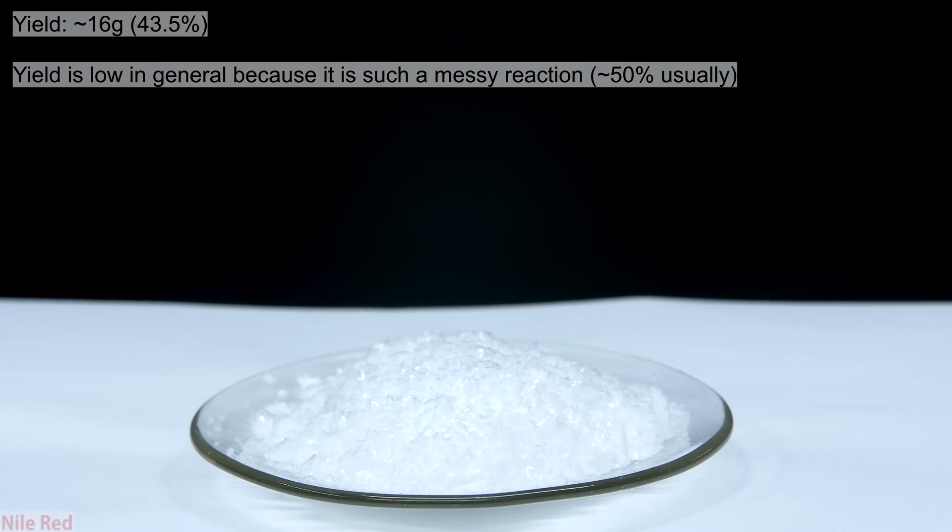In the end, the yield was about 16 grams of oxalic acid dihydrate, which is actually quite low. I don't think this reaction is super efficient on its own, and those added washing steps that I used really didn't help either.